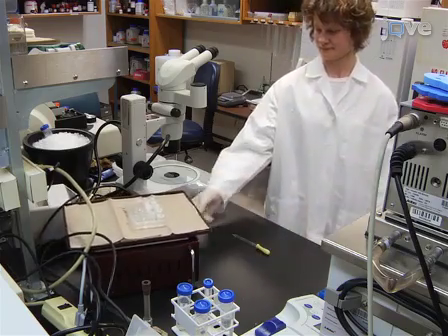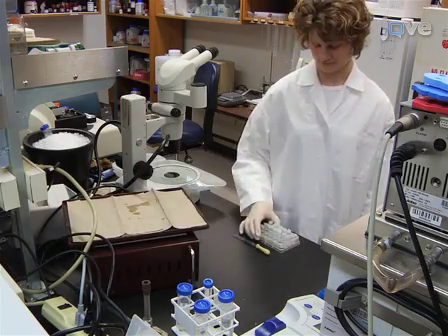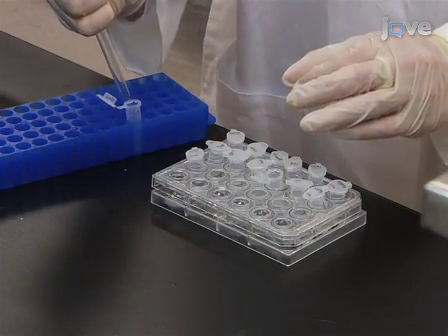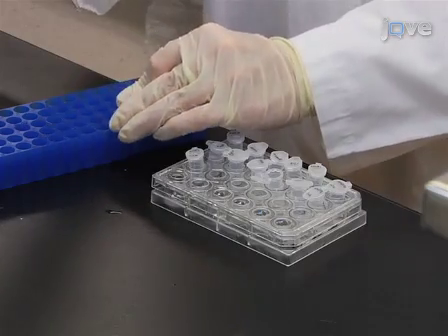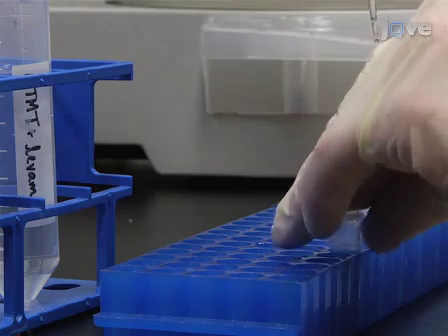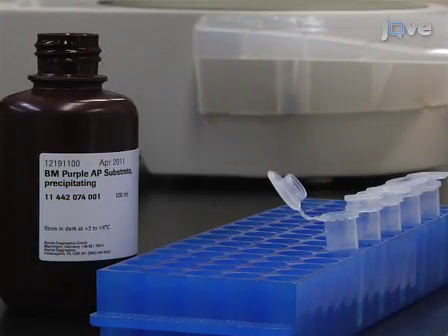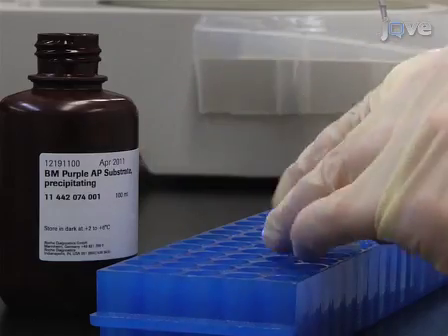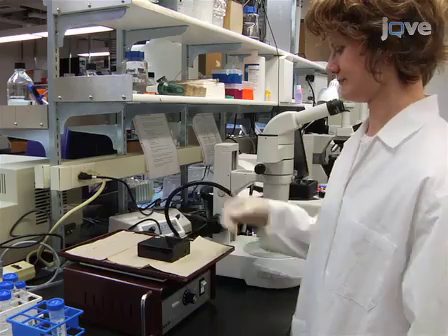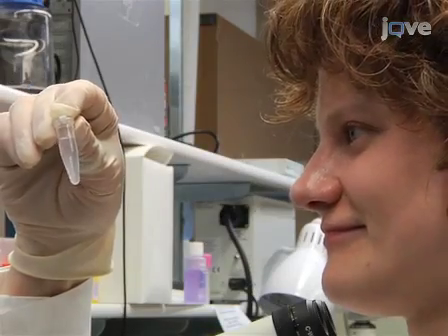On the third day of the procedure, wash the tissues several times in TBS-T with Levamisole. Then, using a glass Pasteur pipette, carefully transfer the tissues into clean microcentrifuge tubes. Wash the tissues for 10 minutes with 1 ml of NT-MT, then replace the solution with NT-MT containing Levamisole and BM Purple. Place the tubes in the dark and, over the next several days, monitor color development and change the solution as needed.